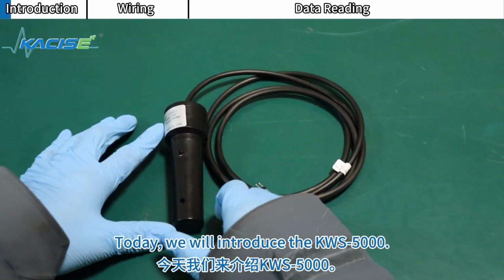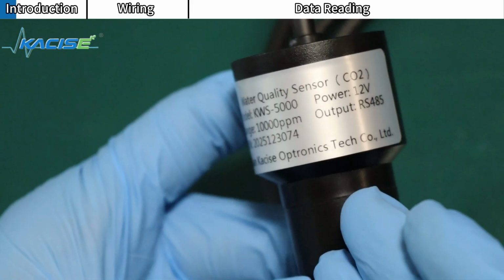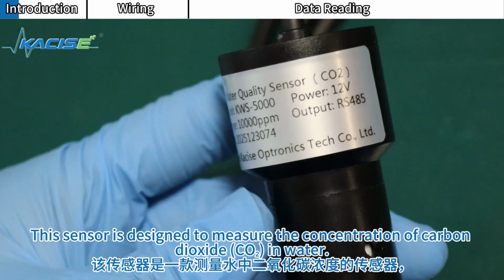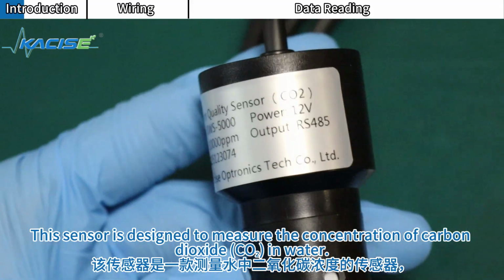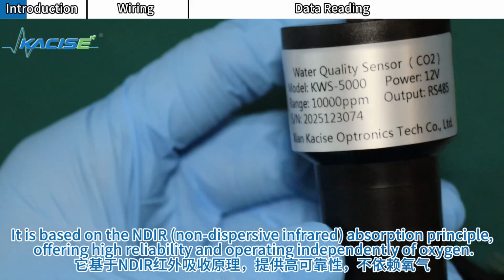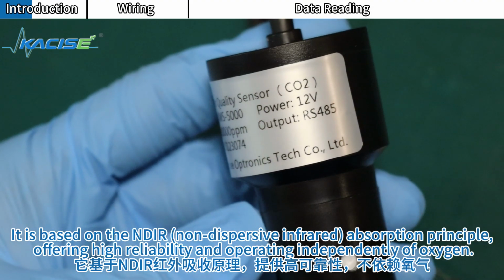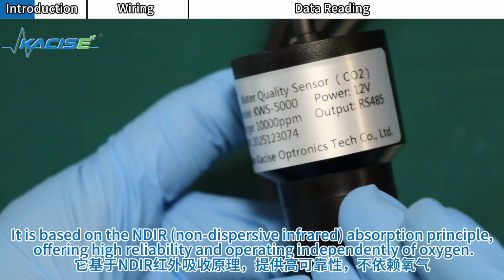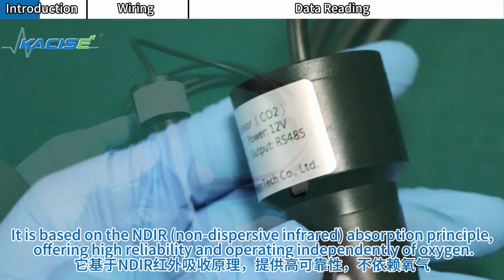Today, we will introduce the KWS-5000. This sensor is designed to measure the concentration of carbon dioxide, CO2, in water. It is based on the NDIR, non-dispersive infrared absorption principle, offering high reliability and operating independently of oxygen.